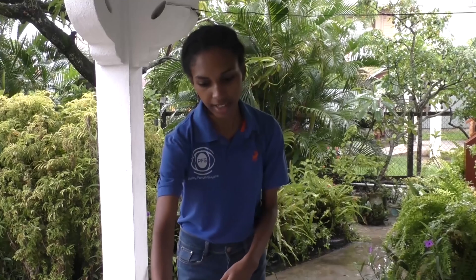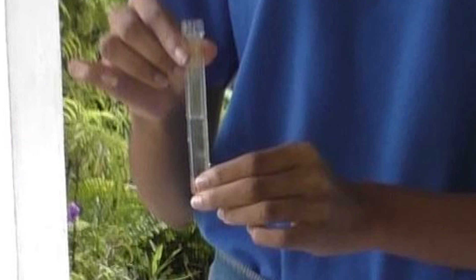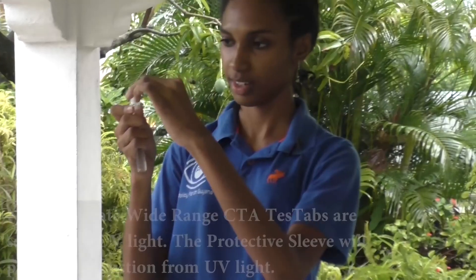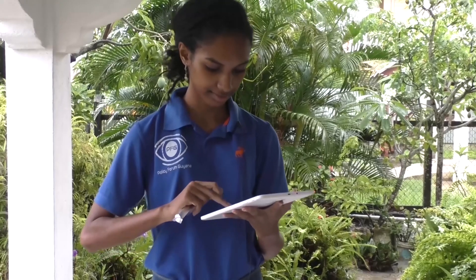We are now going to test for nitrate. Materials needed include the protective sleeve, test tube, tablet, and a stopwatch. Fill the test tube with sample water up to the 5 ml mark. Add the tablet to the sample and place it into the protective sleeve. Start a stopwatch for 2 minutes and invert the test tube until the tablets have dissolved.